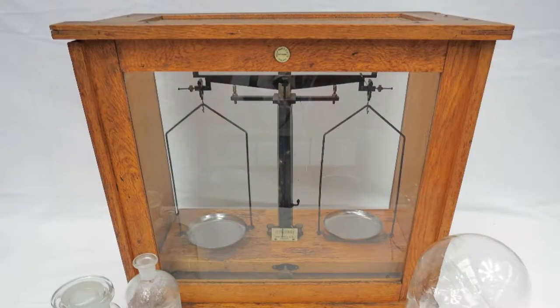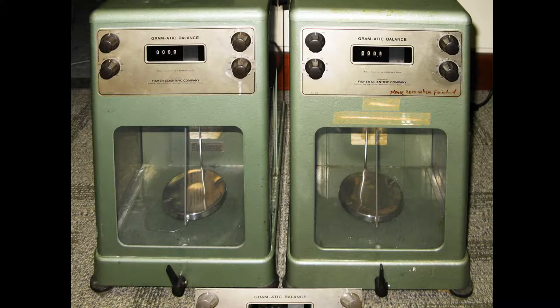Maybe your instructor has seen a balance such as this one, or even used a balance like this.